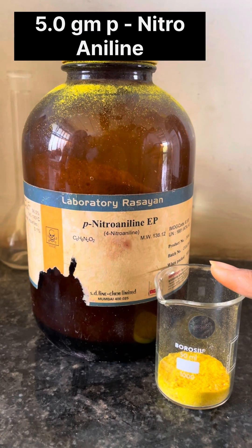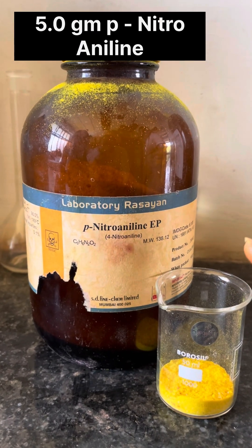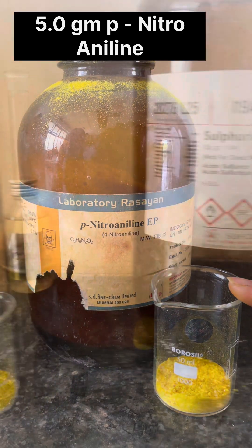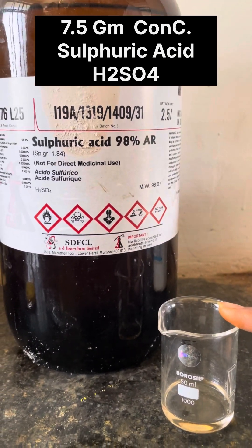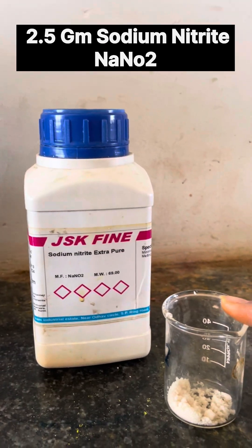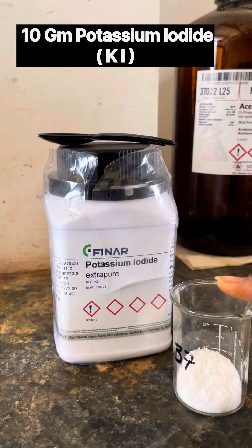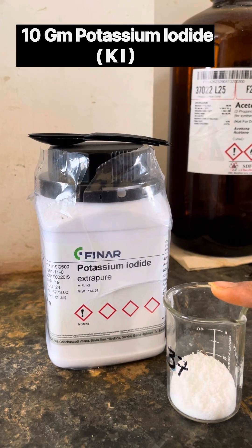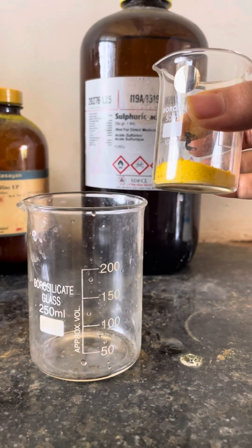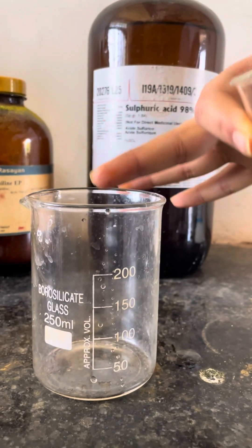The requirements of this procedure are 5g para-nitroaniline, 7.5g concentrated H2SO4, 2.5g sodium nitrite, and 10g potassium iodide. Take 5g of para-nitroaniline in a 250ml beaker.